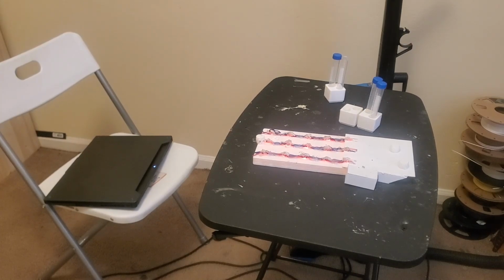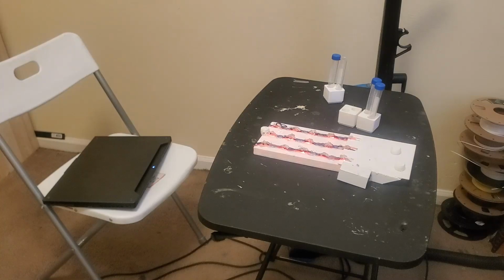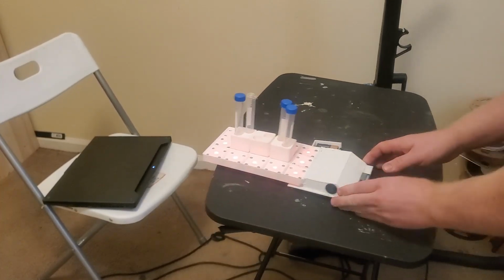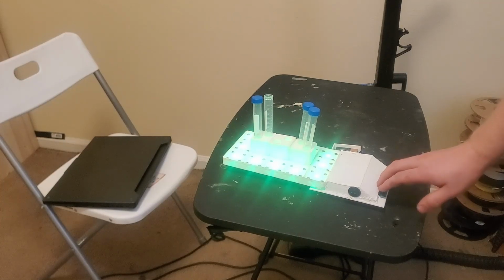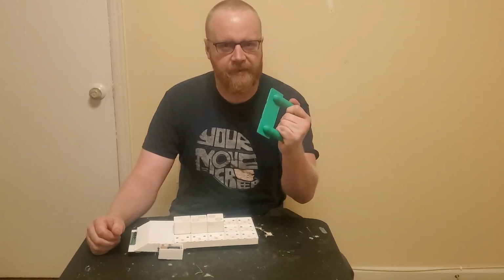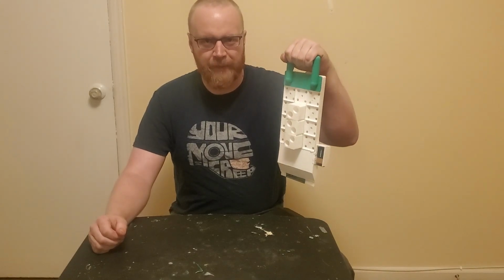But Matt, won't all those wires running into the bottom of a rack make the bottom an absolute mess? Well, where you saw a problem, I saw a chance to add more features. What we have here are 3D printed TPU footies. This rack is now more stable than ever. With those footies, our tubes are not going anywhere. And lastly, because in my personal experience, nothing ever has too many features until it has a detachable carrying handle, let's go ahead and take this down to the lab.